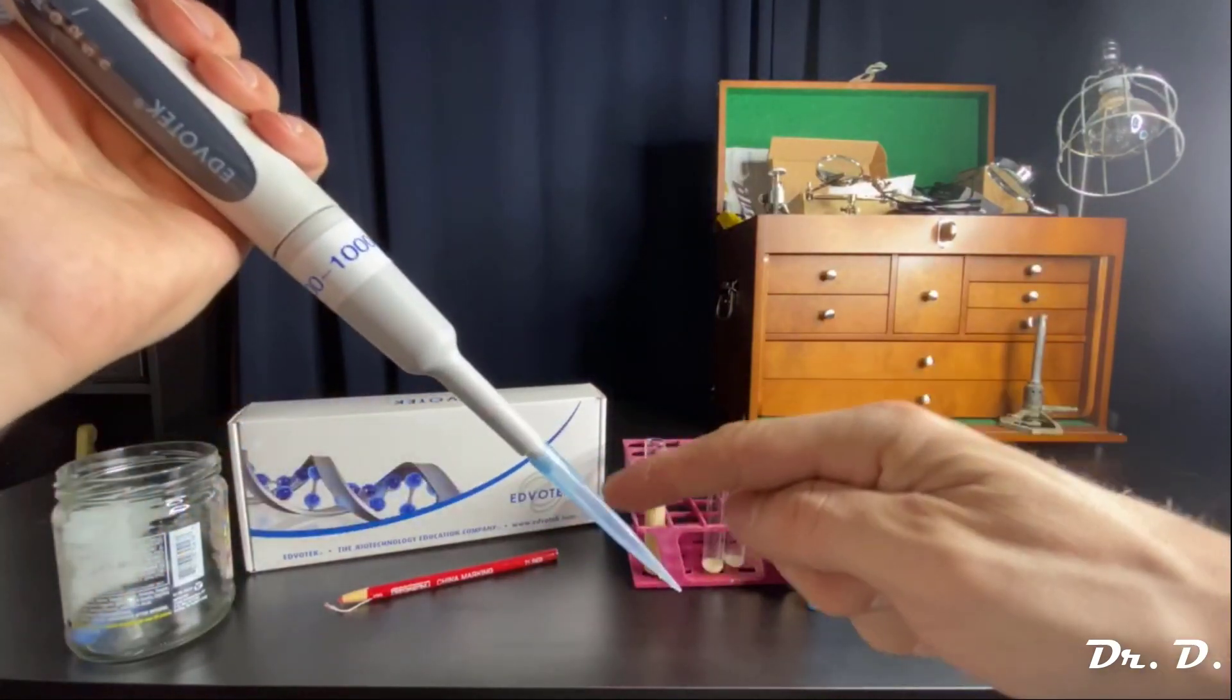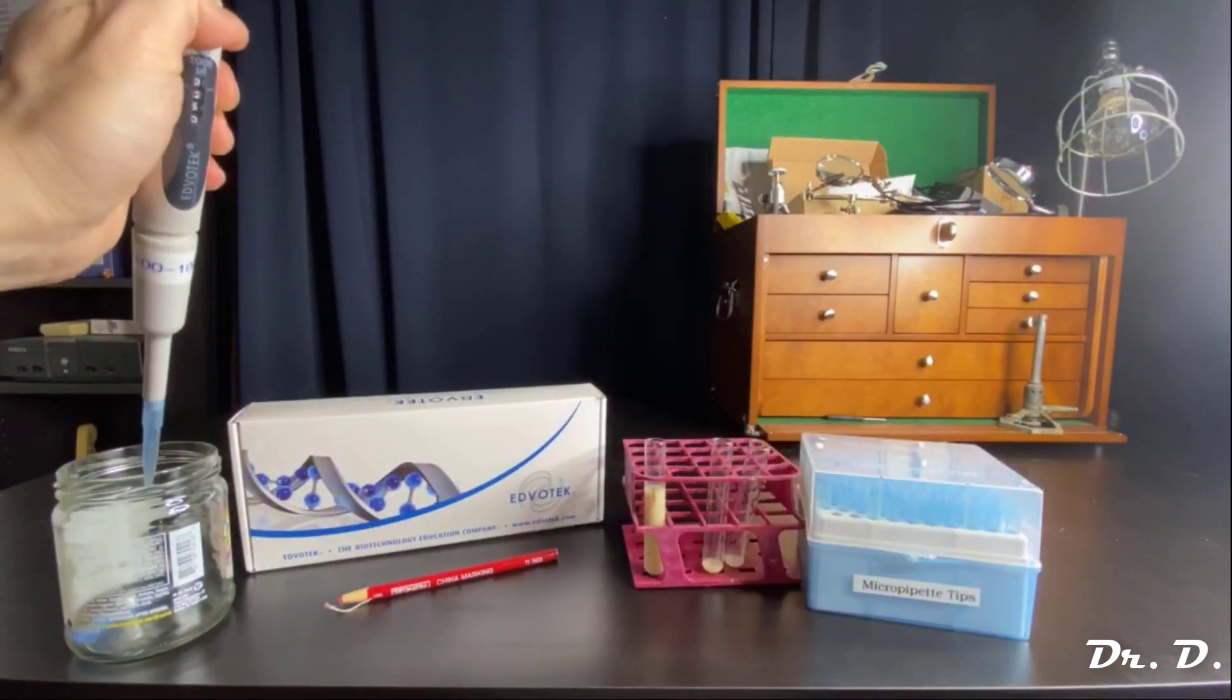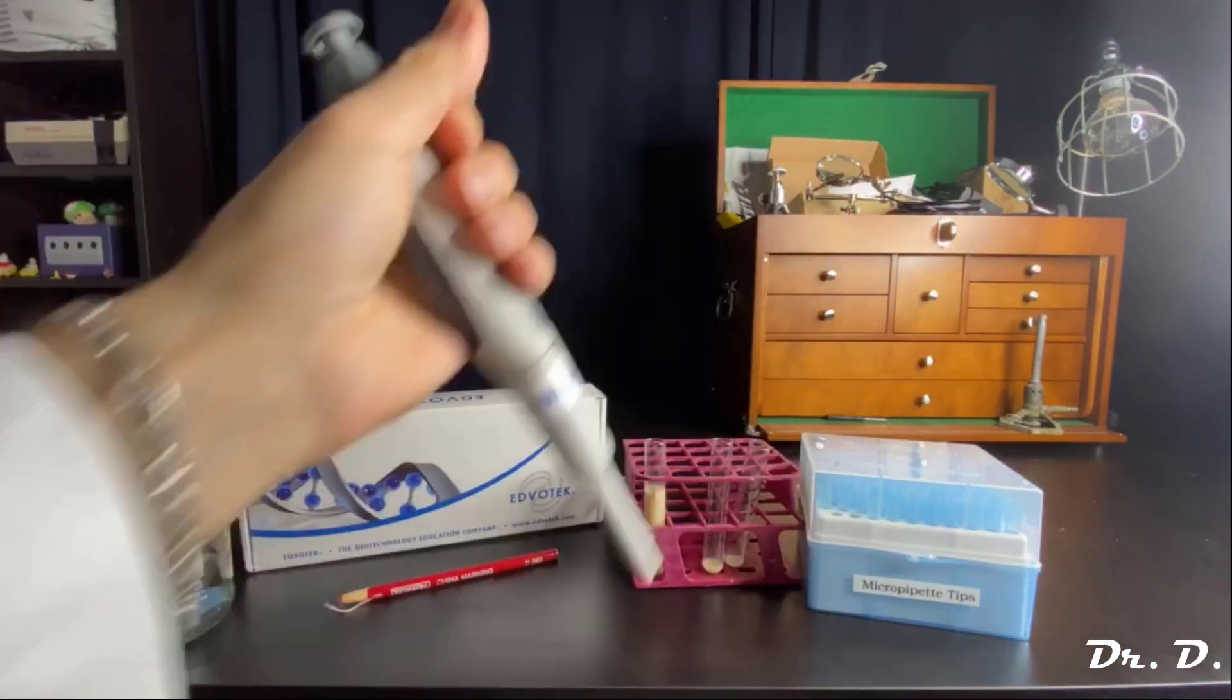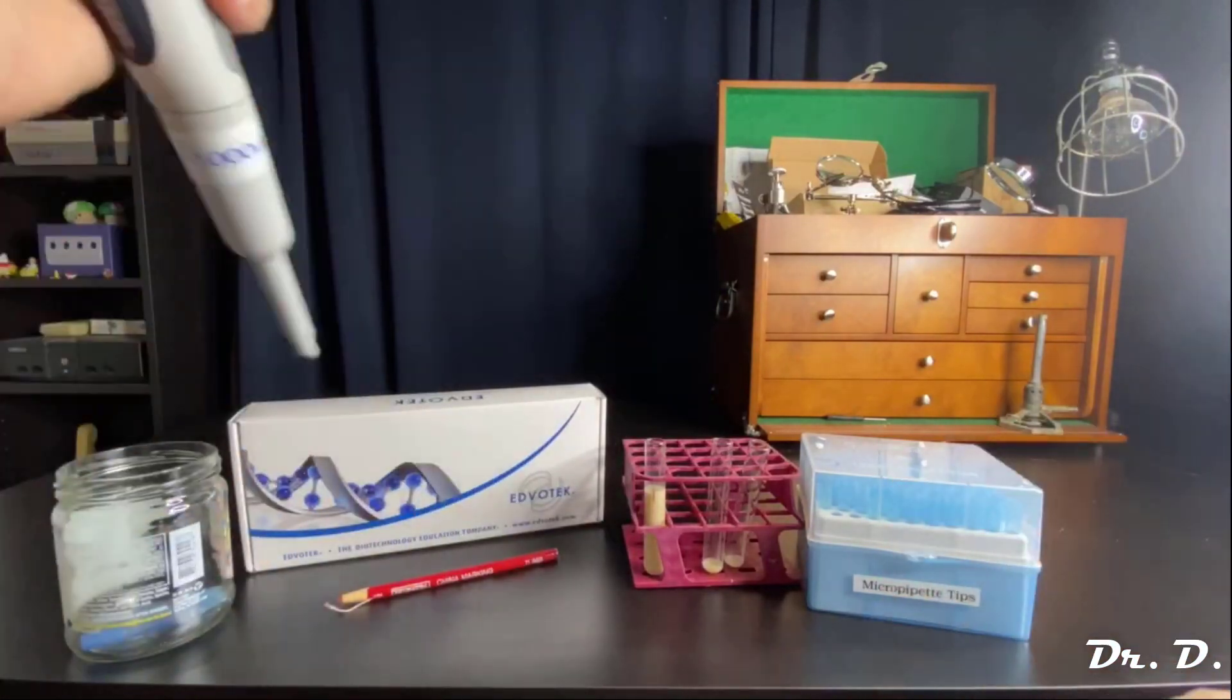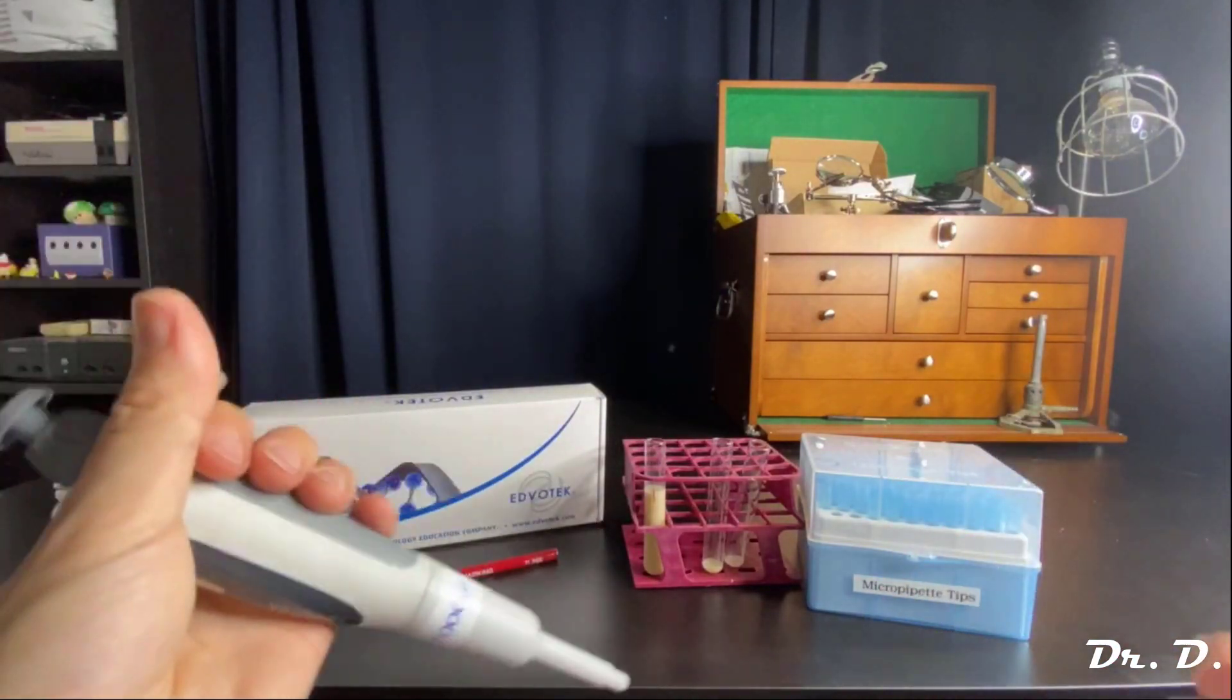And don't forget, always get a fresh disposable tip every time and eject your old one every time. And that's it.